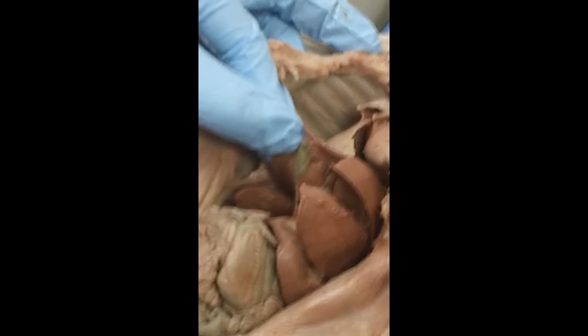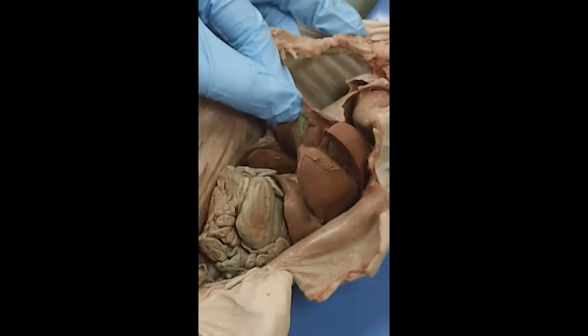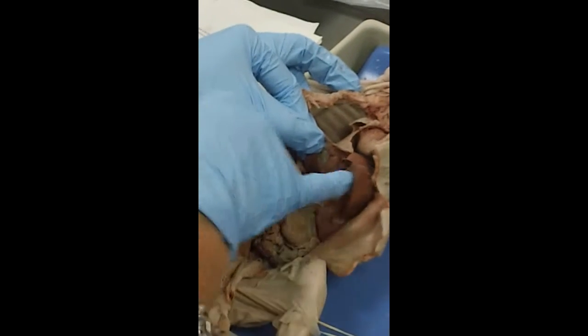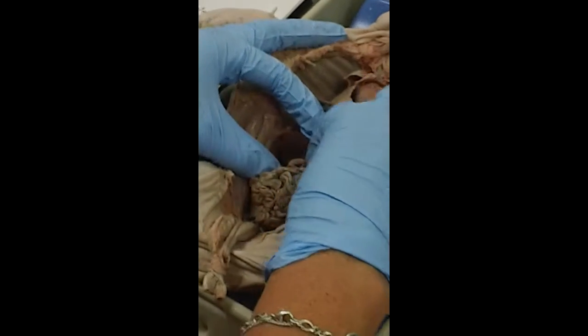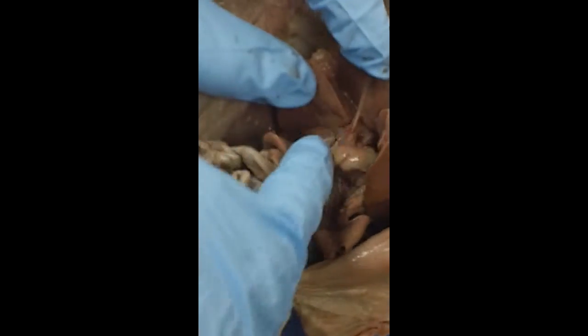And the gallbladder stores that bile produced by the liver and concentrates it. When you eat something that you need the bile for, it goes through this bile duct and into the very first part of the small intestine called the duodenum. And that's where fats are emulsified, in the very first part of the small intestine.